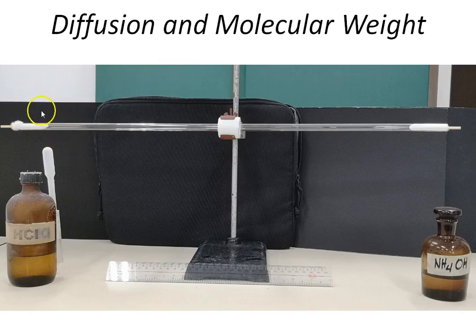After we have placed hydrogen chloride on this end and ammonium hydroxide on the other end, we will observe the tube for a white ring precipitation that will form inside this clear glass tube. Then, using a ruler, we will measure the distance from each end of the tube up to the white ring, and record the data in centimeters. For us to have a better idea of how this is done, I will show you a video demonstration.